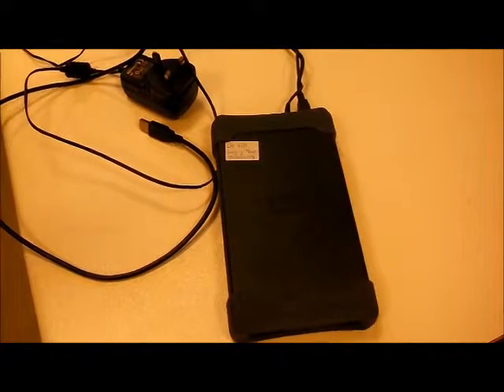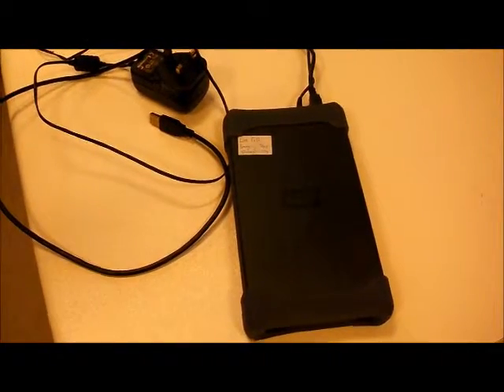Okay, in this little video I just want to show you how to transfer your live cell data from the Mac onto this Mac formatted hard disk. So this is the one. Make sure it says live cell imaging temp on it. So take this over to the live cell imaging PC.